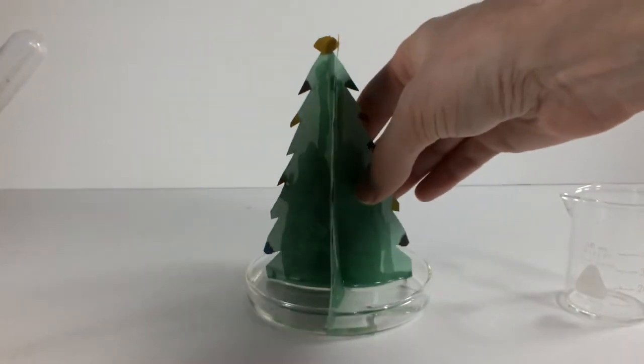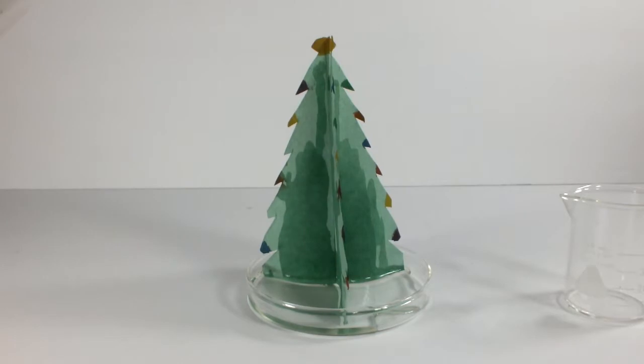They say practice makes perfect, so maybe it's time I start practicing the crystal growing art. For now though, after two or three weeks of this tree looking pretty much exactly like this, I gave up.